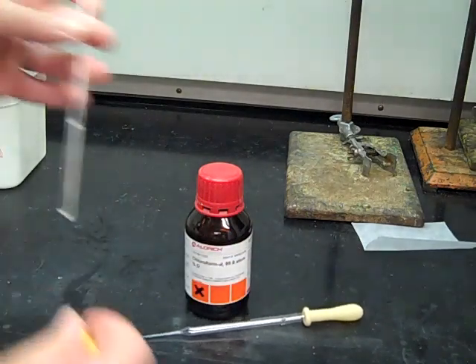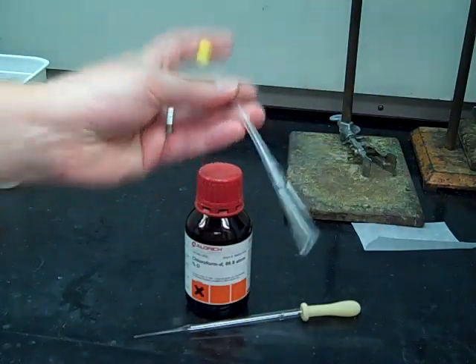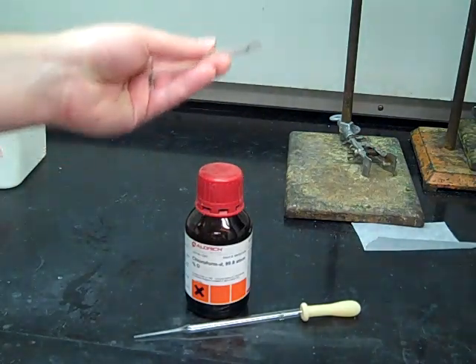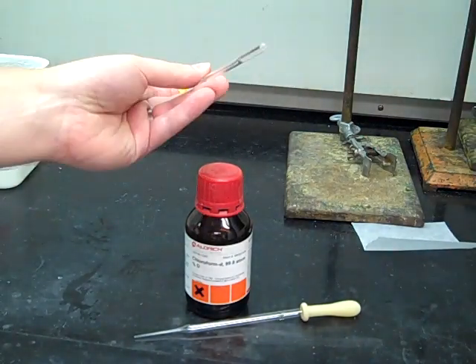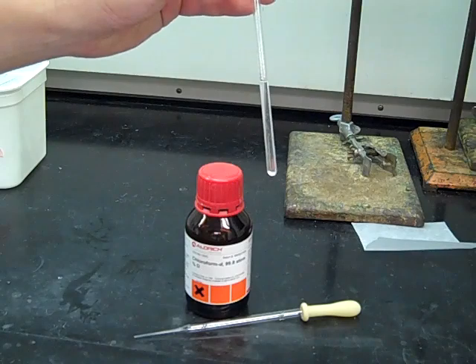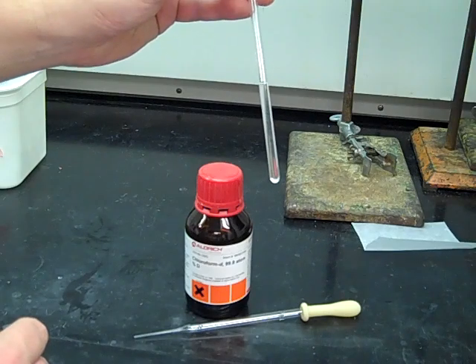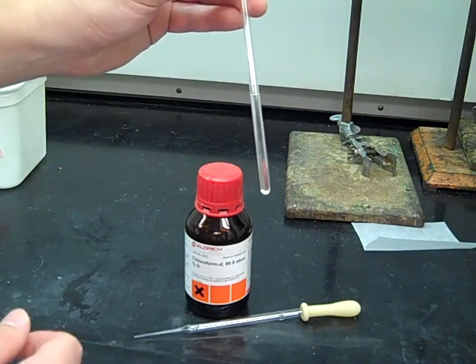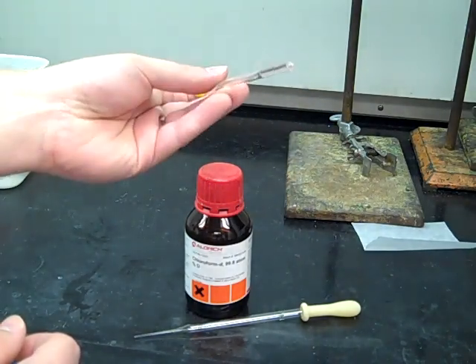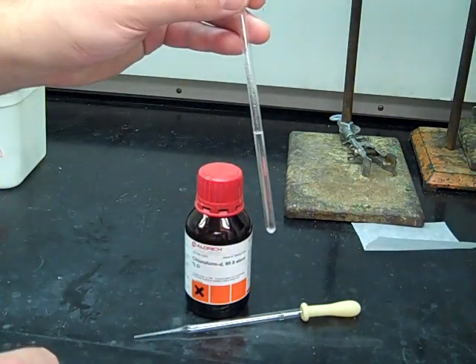So once you've got the correct amount of solvent, you're going to put the cap on and then if your sample didn't dissolve all the way, you want to kind of invert it several times until everything is dissolved into that solvent. Your TA may ask you if chloroform is not sufficient to dissolve your sample. Your TA may ask you to put maybe one to two drops at the most of DMSO, which is a little bit more polar and can help some of those more polar solids dissolve into your NMR solvent. And that dissolution is really important for the actual sample run.